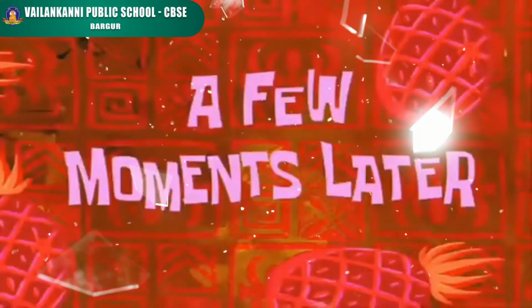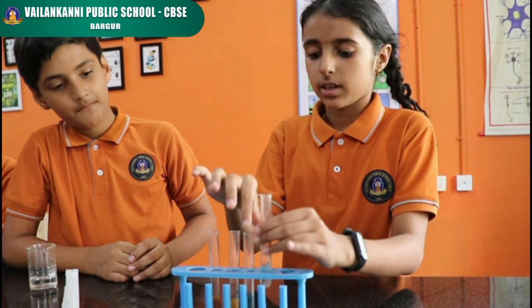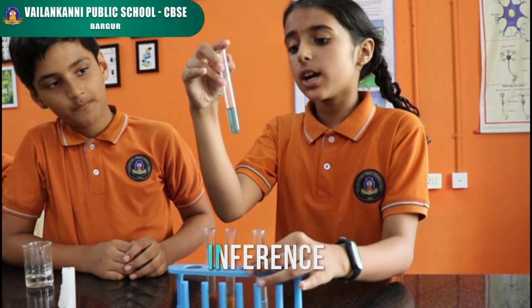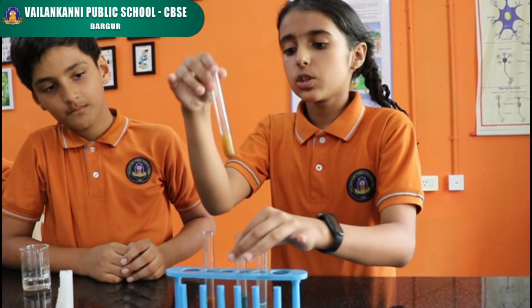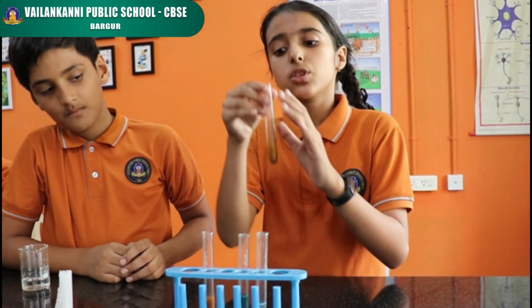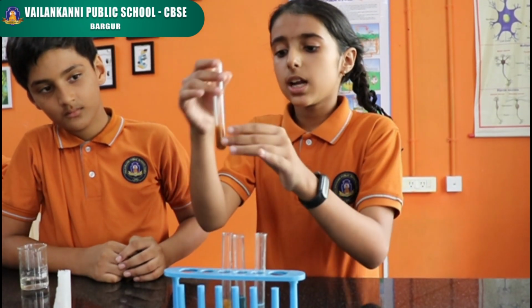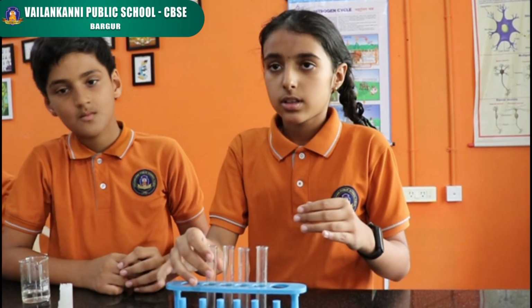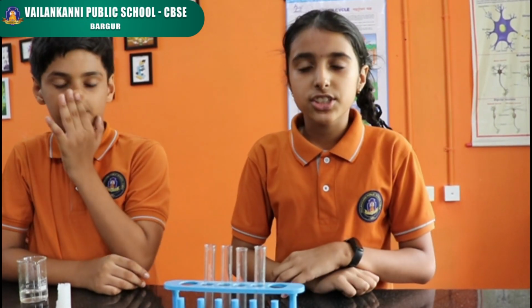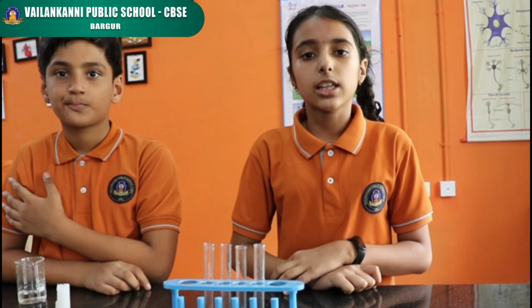A few moments later. The blue color shows the absence of the sugar in the food sample. The green color shows the low content of the sugar in the food sample. The yellow color shows the medium level of sugar in the food sample. The red brick color shows the high level of sugar in the food sample. The color changes in Benedict solutions indicates the presence of sugar in the food sample.